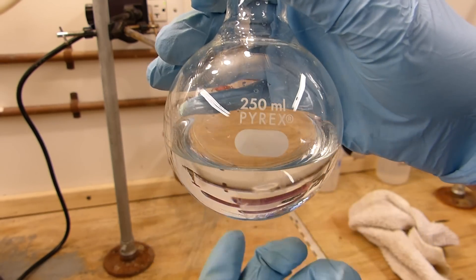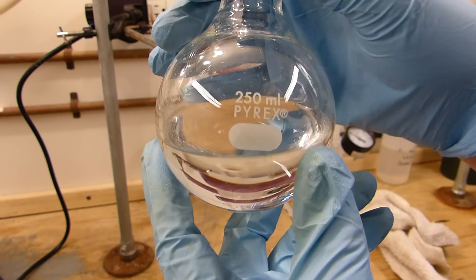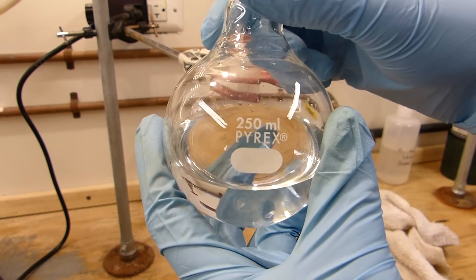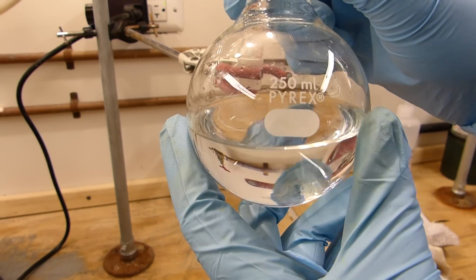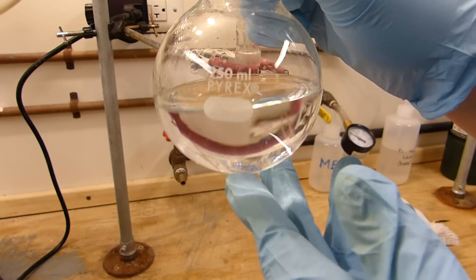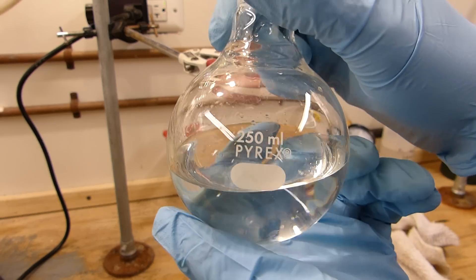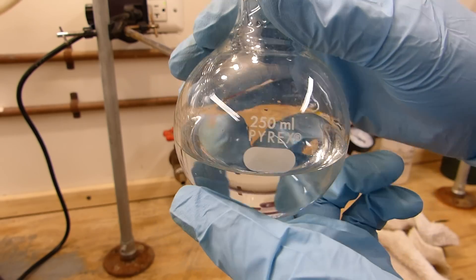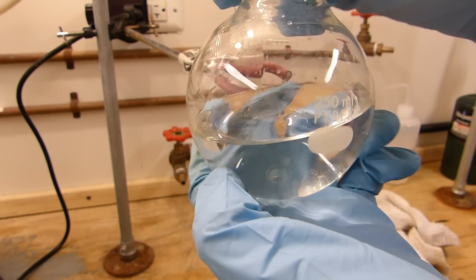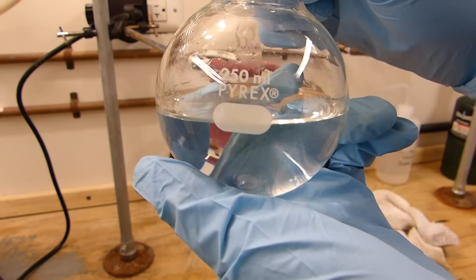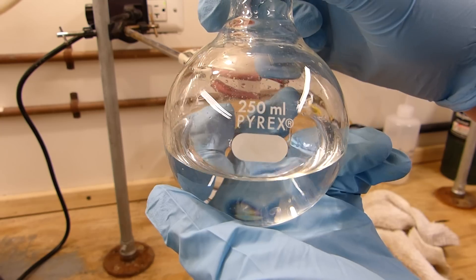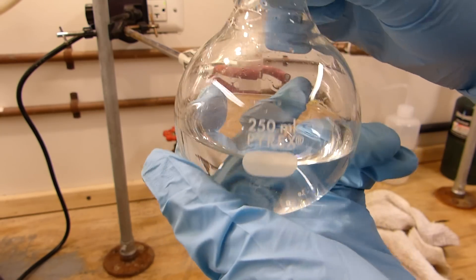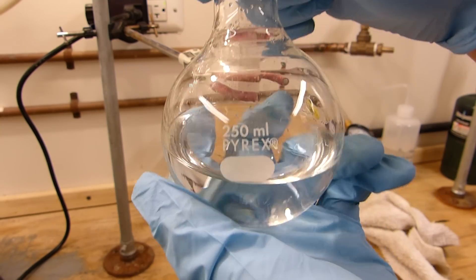And for most purposes that require acetic acid, for most experiments that require acetic acid, I mean, 95% is just fine, or 96%. This can be made glacial by refluxing with acetic anhydride or something like that, which I'll do in a later video to make true glacial acetic acid. But for now, I'll store this in a bottle and call it concentrated acetic acid at roughly 96%. I'll be using this in a number of upcoming videos, so I thought I'd show you how to make it, or how I make it.